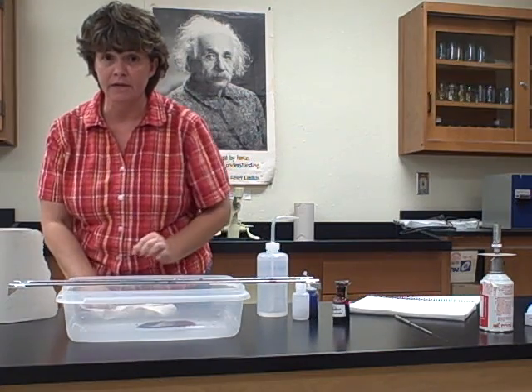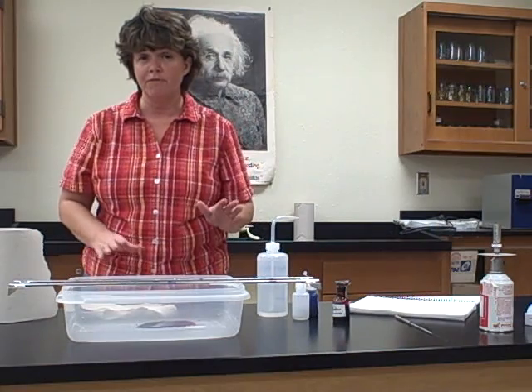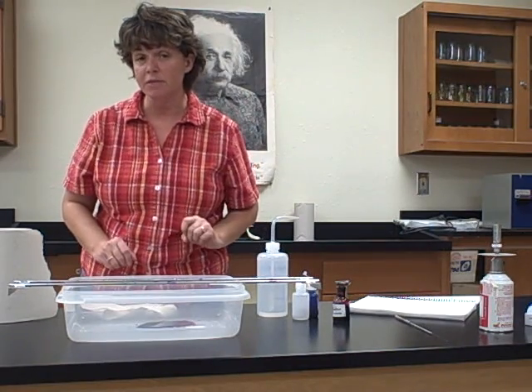Okay, so then we're going to blot it dry with our paper towel. And we're ready to look at it under the microscope. Now, as we do prepare these, like I said, you're going to want to be very efficient. So this is one of the 4 stains that we're going to be doing today.